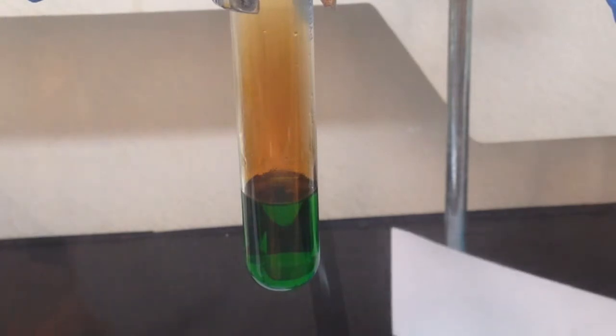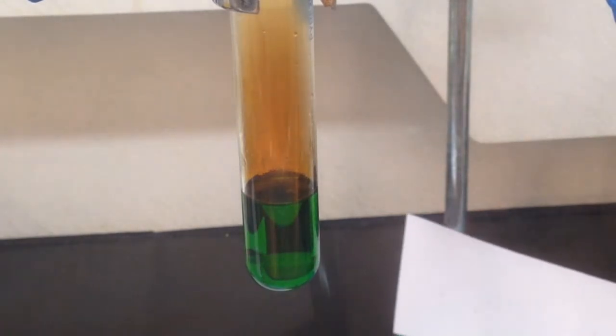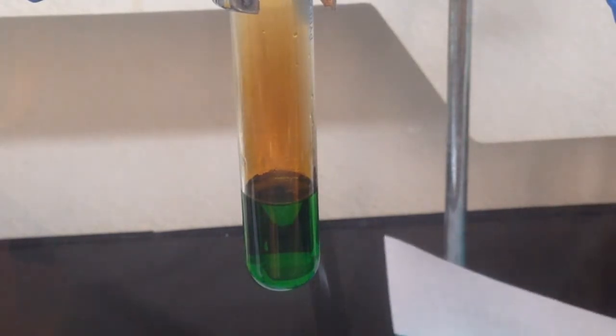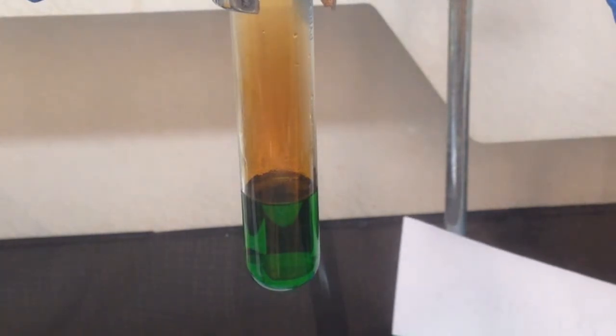You'll notice that some brown gas appeared right above the surface. That is nitrogen dioxide. Nitrogen dioxide is extremely toxic and highly water soluble. Nitrogen dioxide is one of the pollutant gases in the air.